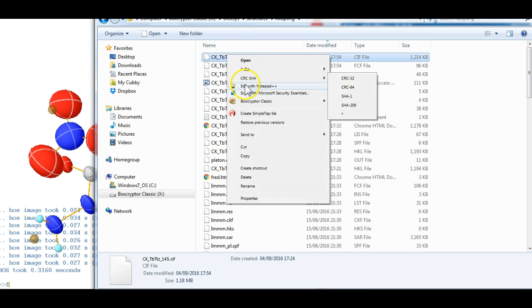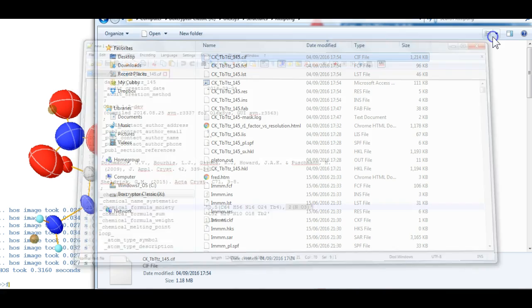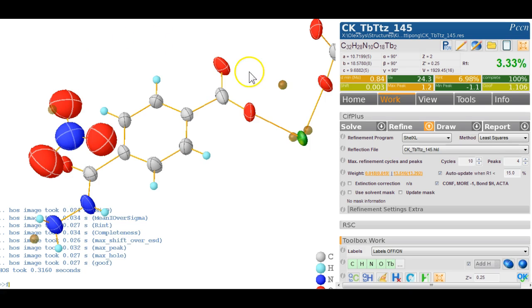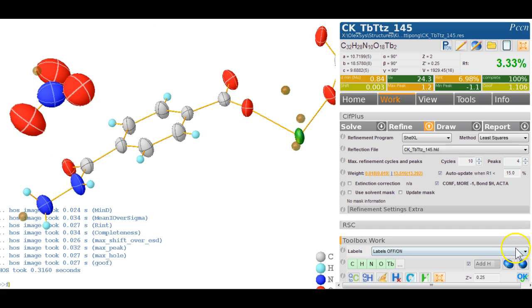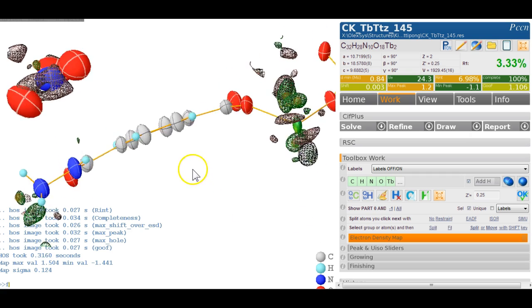If I open this with Notepad++, and if you look at the moiety formula, you see it's got half of those and then 2 nitrates per unit. So this is all sorted out for you, and that makes hopefully some chemical sense. And I think as far as that's concerned, one last thing we can check is to just have a quick look at the electron density map and see whether there's anything going on that's too terrible.